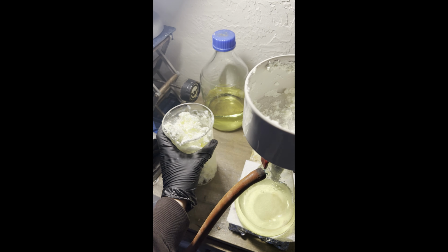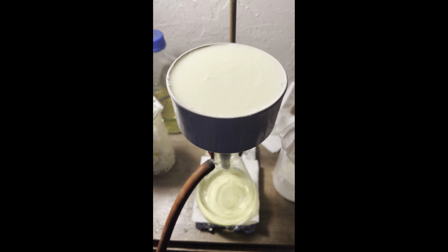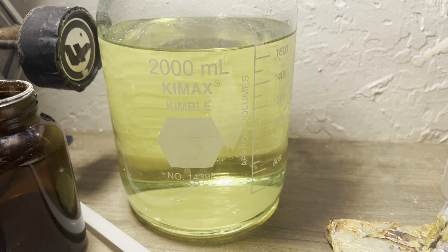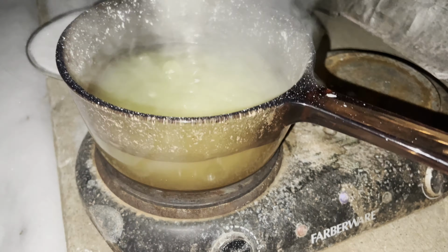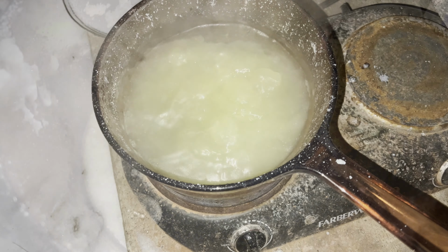I transferred the combined crude acid crops to the same pot as before, added some water to it, boiled it, let it cool, and filtered it again. This wasn't a recrystallization, as I'd need like 4 liters of water for this much acid. Rather, it's a way to both remove the residual dilute acid and stuff adhering to the paste, and in the process, significantly reduce the volume.